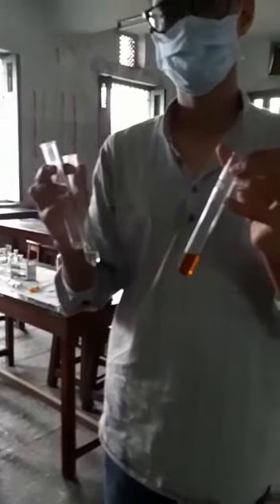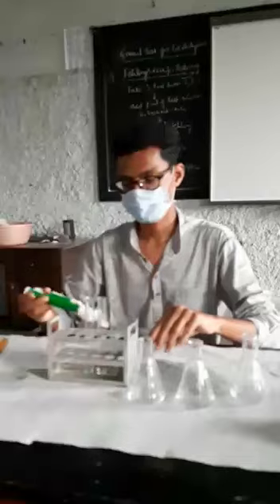Now as usual, the samples are heated in the hot water bath and we will wait for few minutes so that there will be a change in the color to brick red. After 5 minutes, there is a change in the color of the sample. Okay, we'll come in the light so that we can observe. For the first sample, he got the brick red color, and the other 2 samples he could not get any color. That indicates that wherever you found the brick red color, that indicates the presence of reducing sugars. Test done by Fehling's solution.